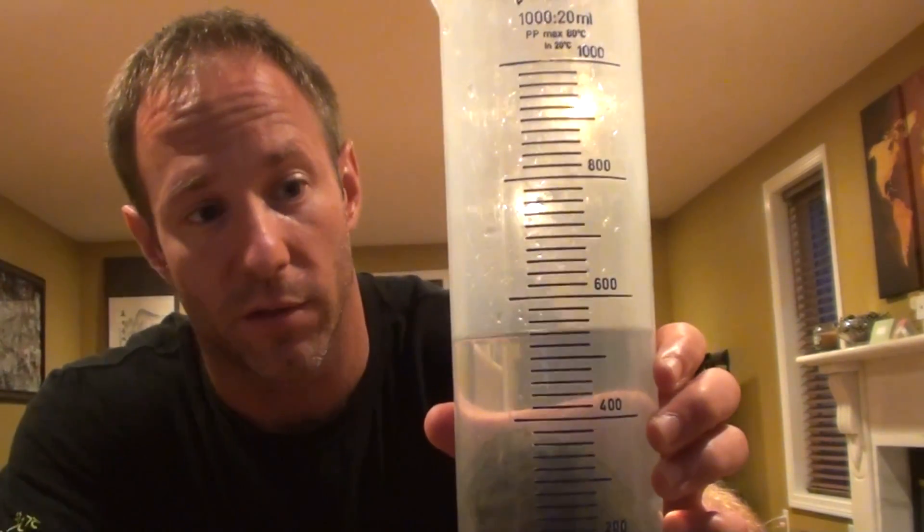Now you need to add the solid object. To do this, you want to tilt the graduated cylinder and very gently add the solid object — you want it to go in very slowly so no water spills out. If water does spill out, my advice would be to just start over and do it again, because if you continue you're going to get an inaccurate measurement. You always want to be as accurate and precise as possible. As you can tell, the water level has risen.